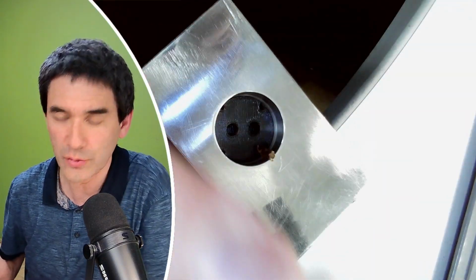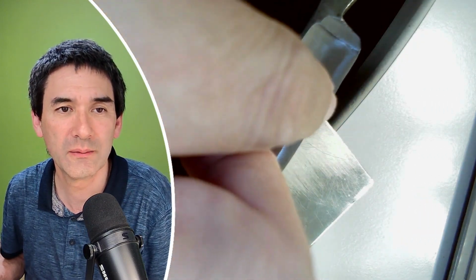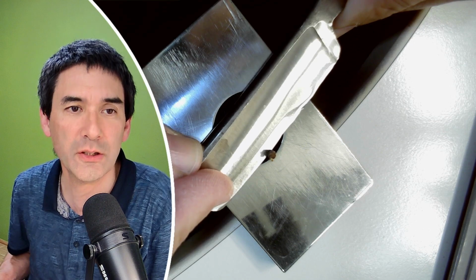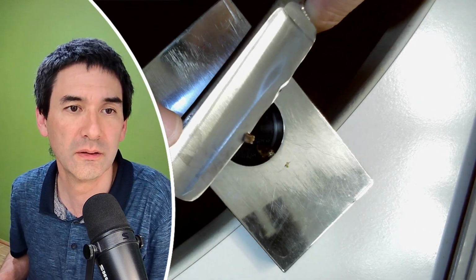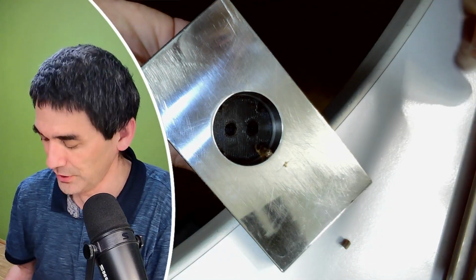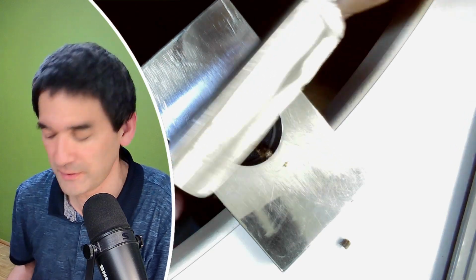So let's try this knife here first. So that's the one over here, yeah, with this little damaged part here. So let's see if I'm able to make a cut. And actually not. It actually ripped it a little bit even. Yeah, I think it becomes very clear already that this is not going to work well. I'm going to advance it a little bit upwards. Let's give it a second try. It's not even high enough yet.